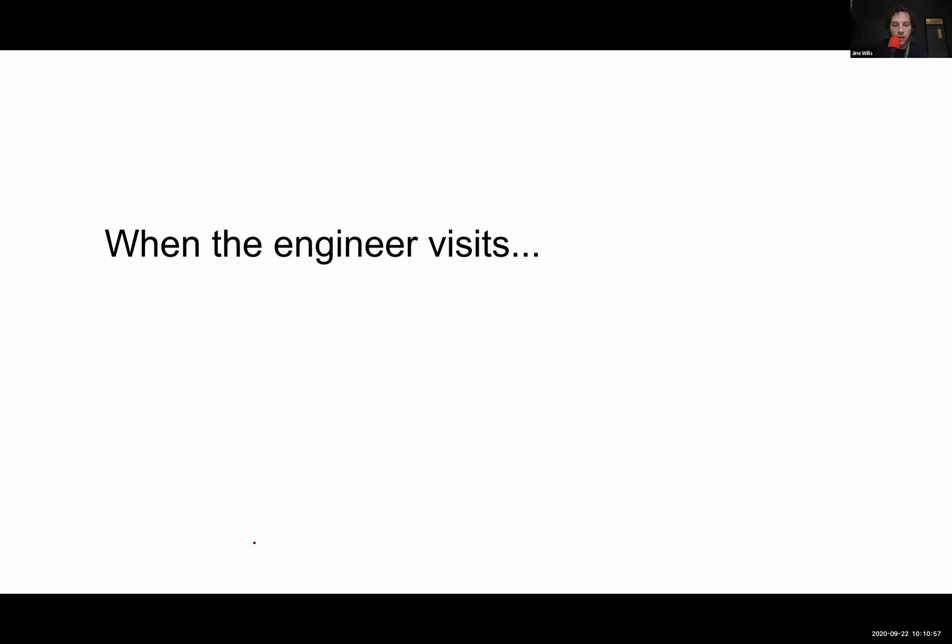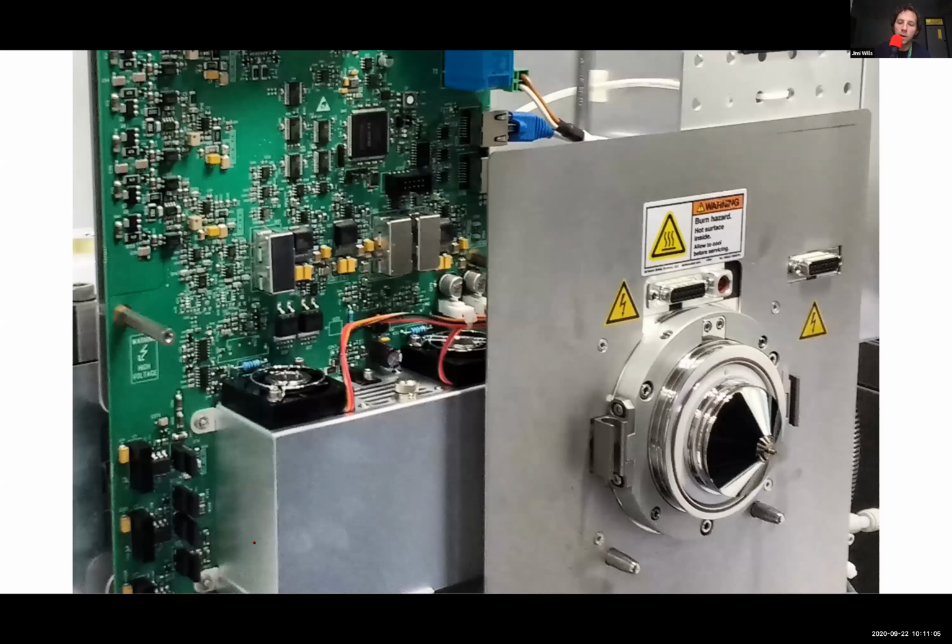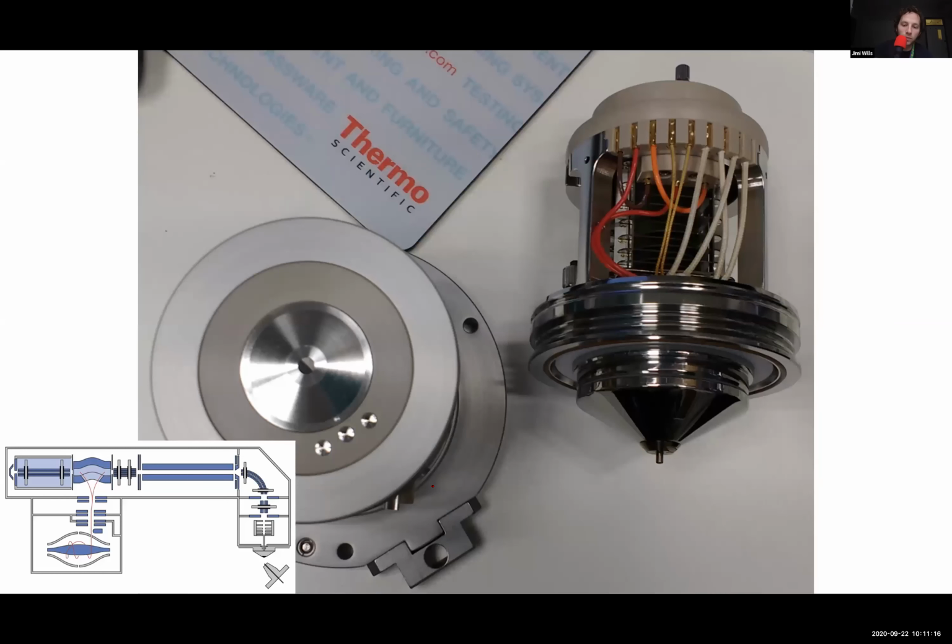When the engineer visits, we take the covers off, and I take loads of photos to show you guys what it looks like inside. So we're just going to have a quick look at that now. So this is where the ions come in, the front of the instrument. This is with the cover off, and you can see stuff behind there. So this is the front of the instrument. This is an ion transfer tube that carries the ions from the outside to the inside, where it's a vacuum on the inside. And because it's a vacuum, the ions try and spread out as they come in, along with the gas and everything else that comes in there.